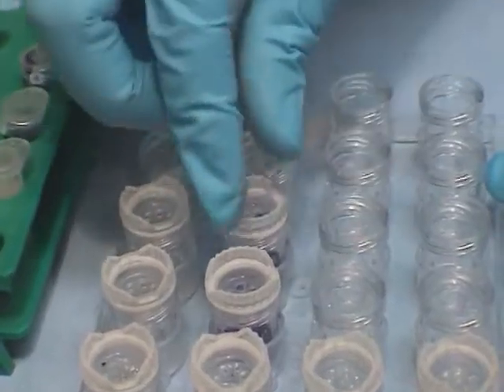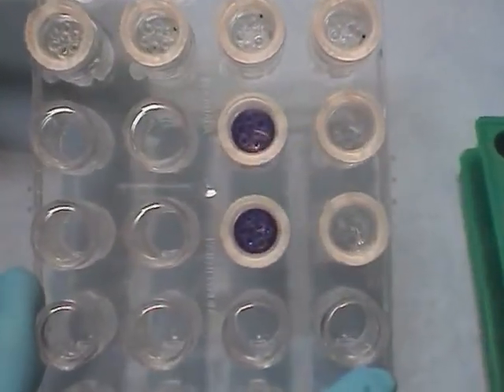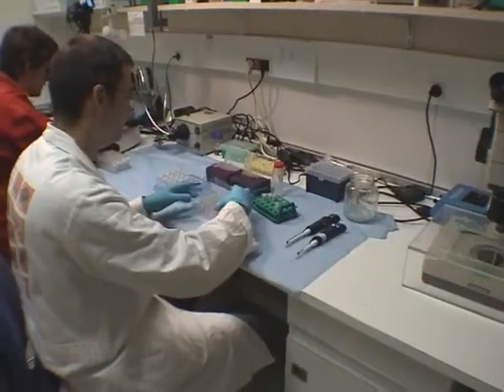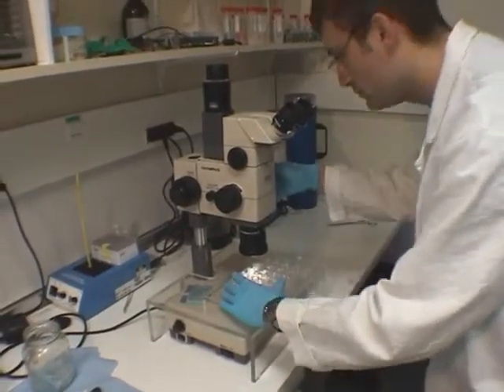After hermetically sealing the plate, the concentrated solution in the wells absorbs the ambient water vapor to dehydrate and thus concentrate the drop containing the target molecule and the crystallizing agent.